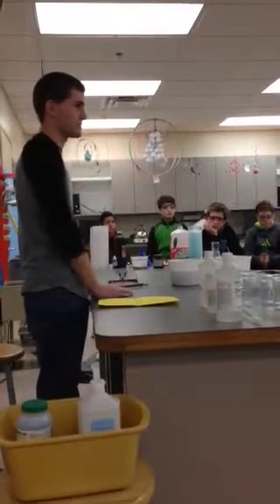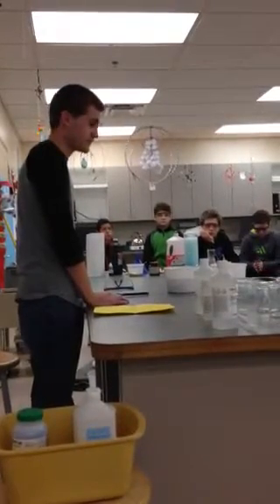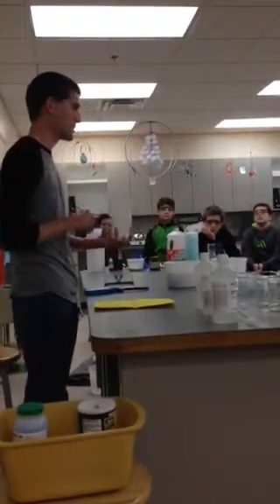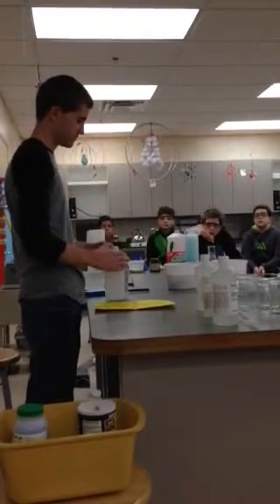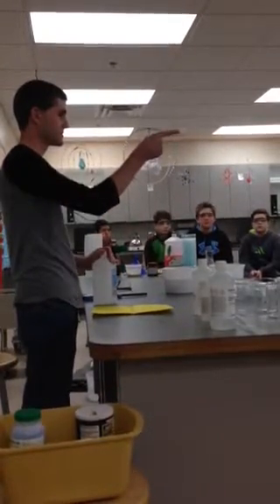I think it was physical because there was really no change at all except when you poured the liquid on, that's what created the flame. Okay, let me tell you what liquid I poured on there. I poured isopropyl alcohol, or rubbing alcohol. It's extremely flammable. What happens when you have a fire? You have a fire, a flame. What does that tell you?